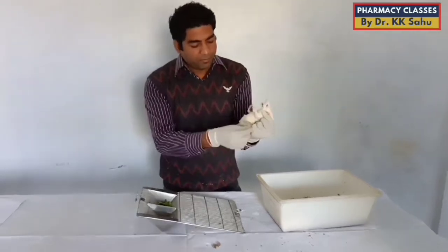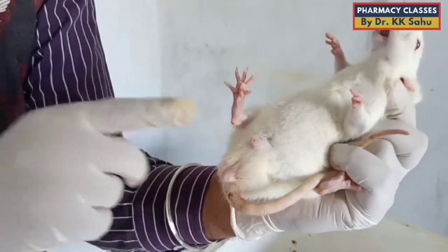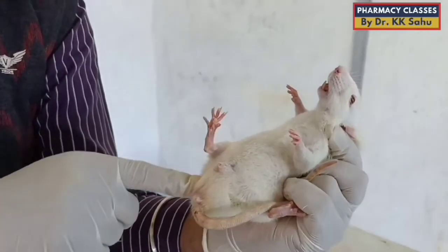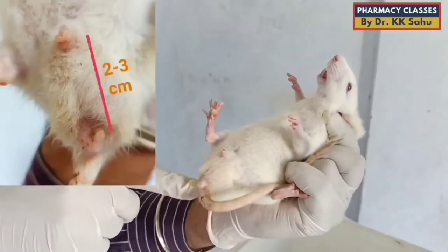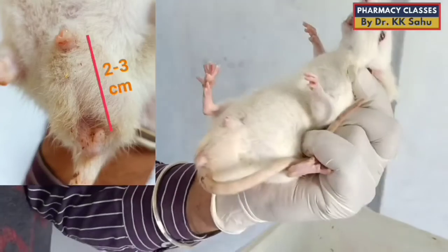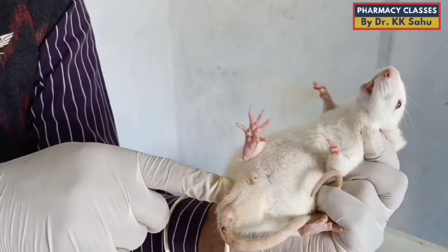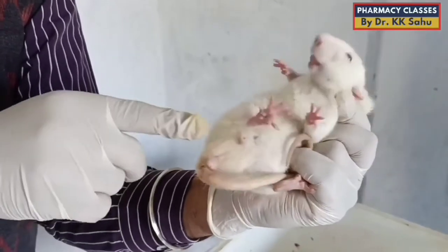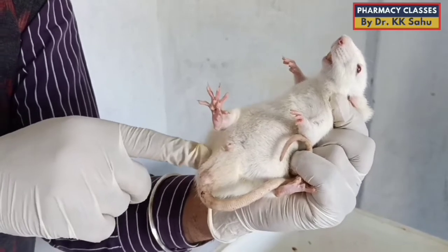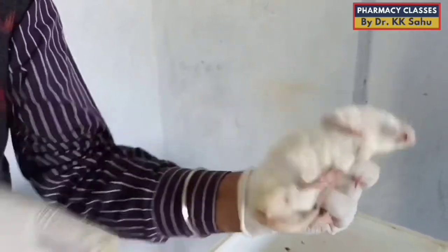Now you can see how I hold it — it is a male rat. The urogenital distance, that is the distance between the anus and the reproductive organ, is about 2 to 3 cm in case of the male rat. You can also see the testicular appearance, which is prominent in case of the male rat and seen clearly; especially in summer seasons it is more enlarged and easily differentiable.